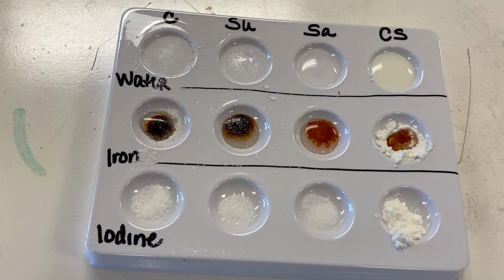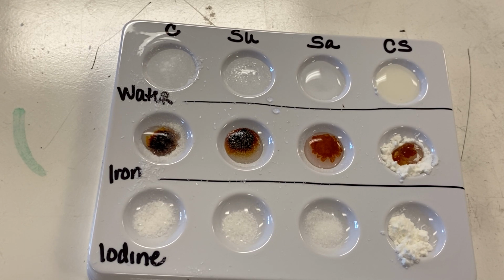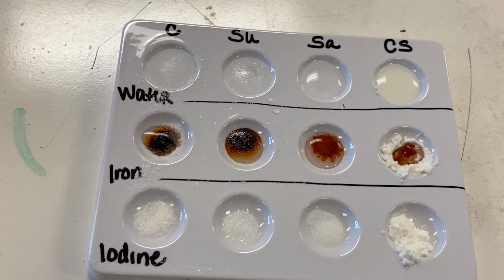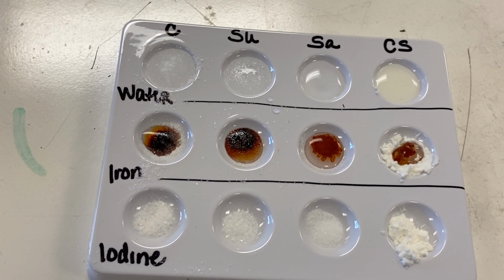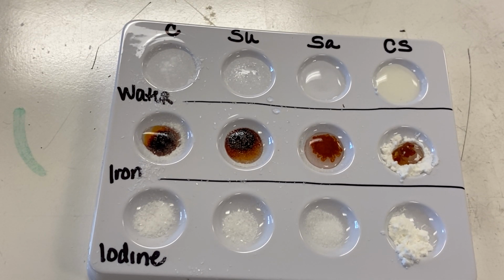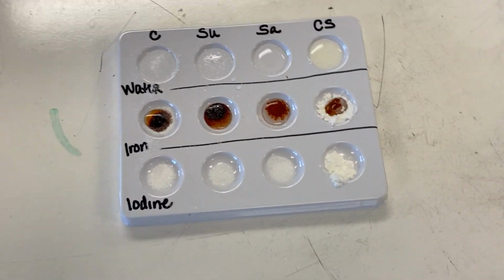So the control turned a really dark reddish brown. A little orange in there. Kind of an orangish purple, actually. Looks like the sugar is the same color. The salt actually just looks like a real rust color, a yellow brown. And the same with the cornstarch. Sort of a rust color. Let me see if I can get it close so that you guys can see what those look like.